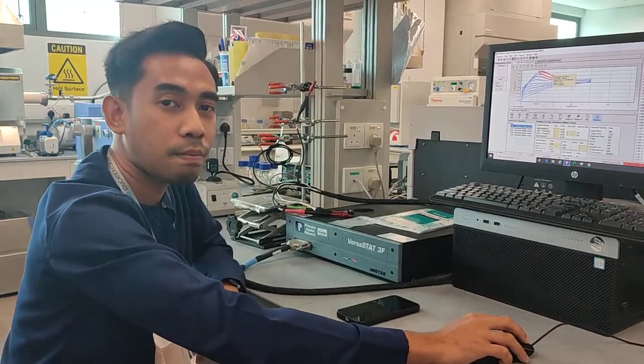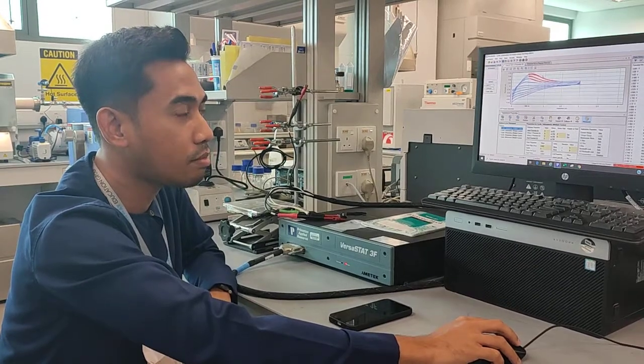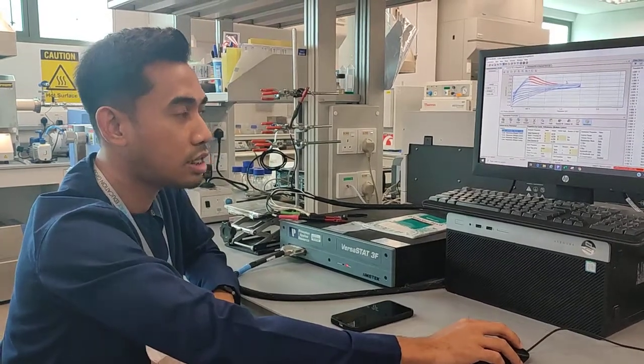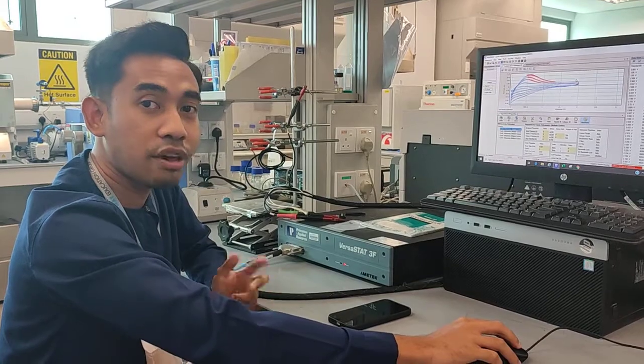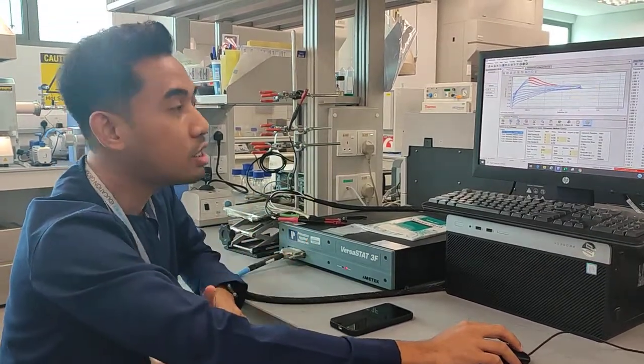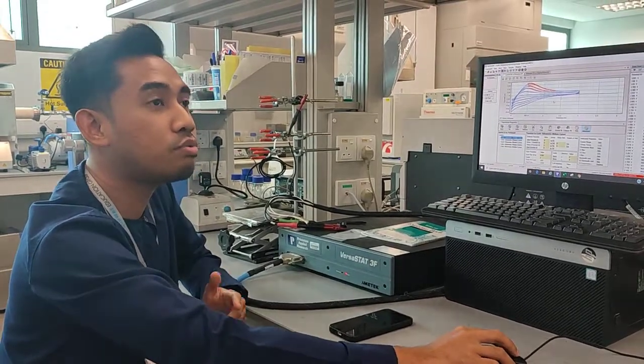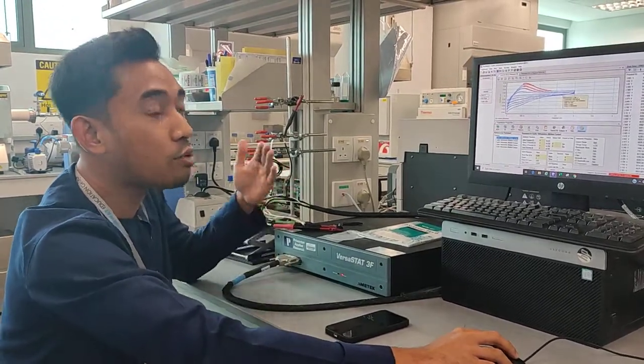So what is the indicator to see the lithiation or de-lithiation happening? Is it the redox peak? Yes. We have half cell and full cell, but this one I focus on half cell. For half cell, normally we go discharge first, which means we undergo reduction first.